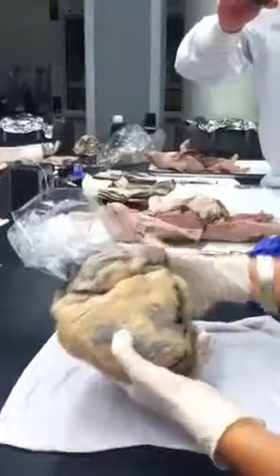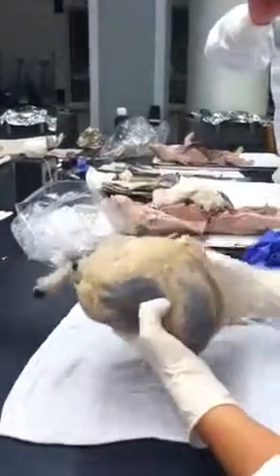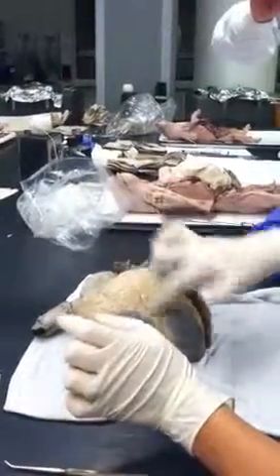Okay, so the back here is really confusing. We have a lot of holes, but we'll go through them. I'm trying to think of what else I need to tell you about the outside. Okay, right. So on your pigs, you have it. It's been taken off on this one.